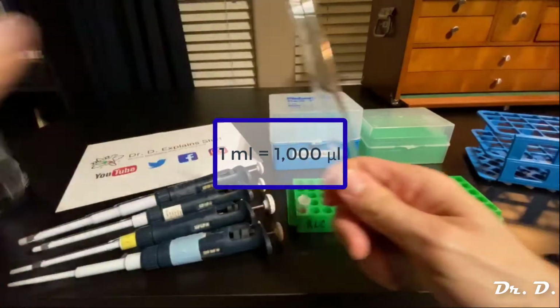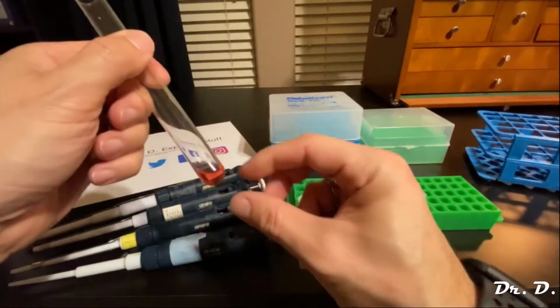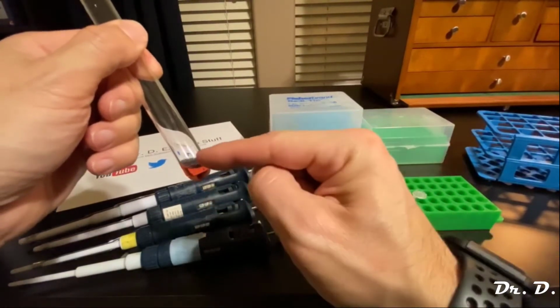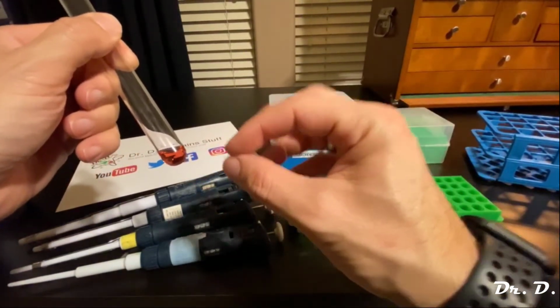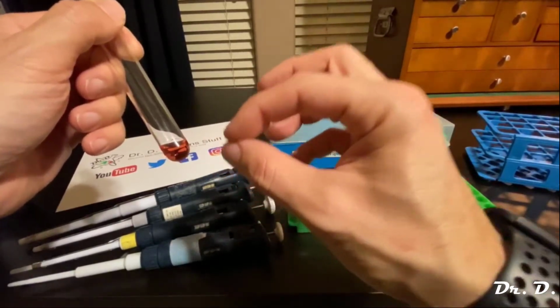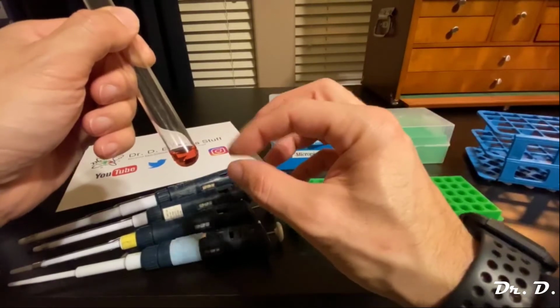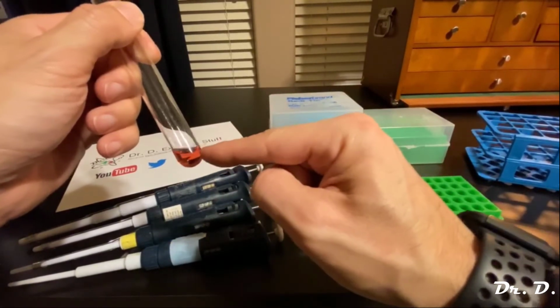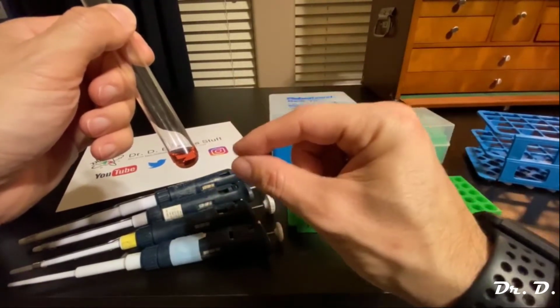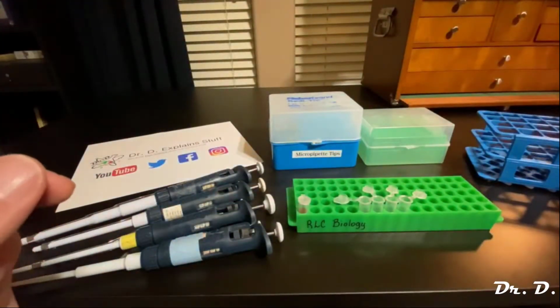So the difference between this and this is the difference between this and a microliter. So you can imagine a microliter is very tiny. It's 10 to the minus 6 liters. A milliliter is 10 to the minus 3 liters, and a microliter is 10 to the minus 6 liters. So that's a tiny, tiny, tiny volume, but not so tiny that we don't need to be working with it.